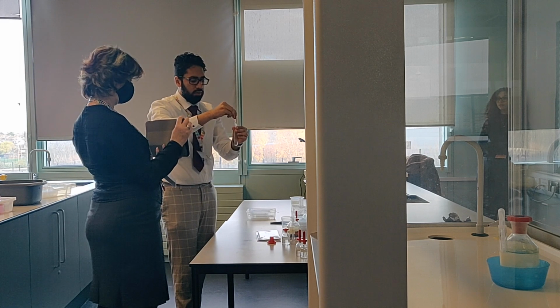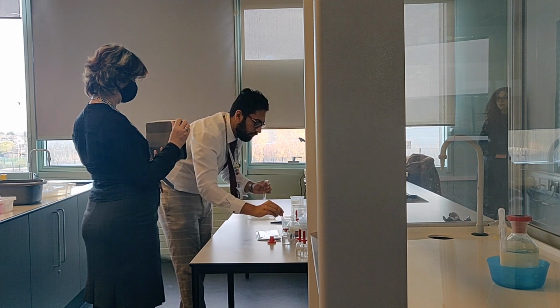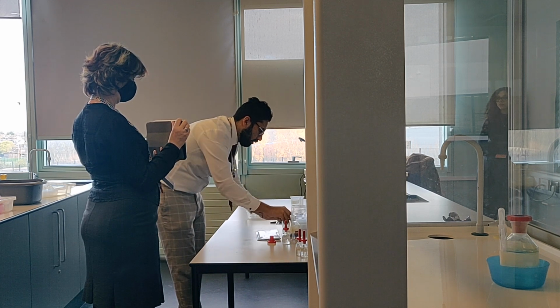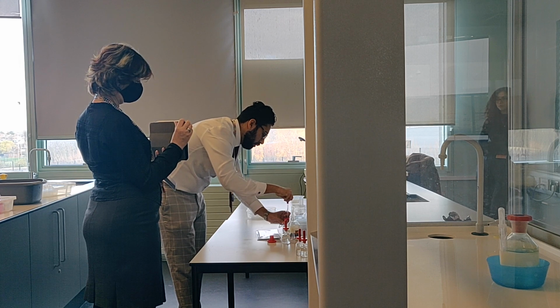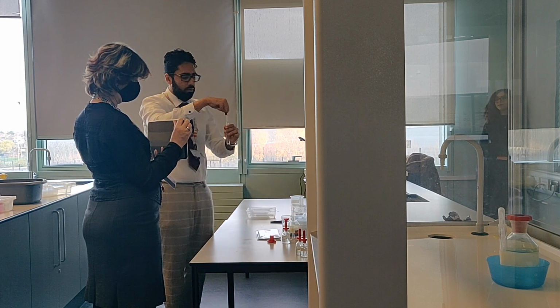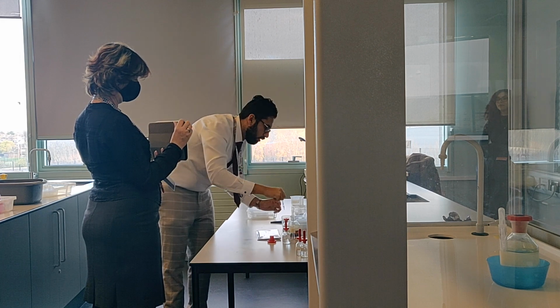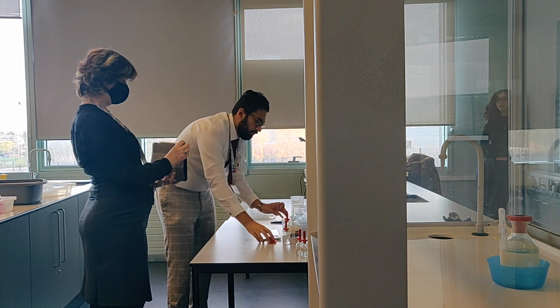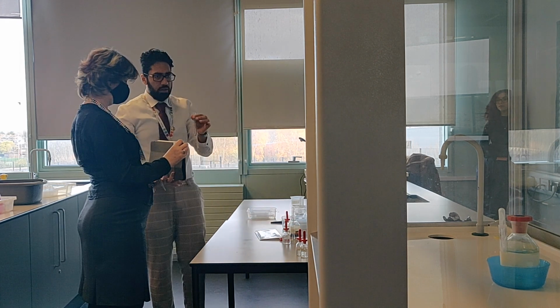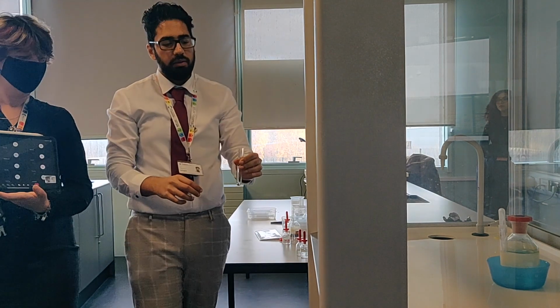1, 2, 3, 4, 5, 6, 7, 8, 9, 10. Okay, and then 5: 1, 2, 3, 4, 5. Okay, this time I'm going to use the concentrated ammonia solution, which is in the fume cupboard, and we're going to do the rest of it in the fume cupboard.